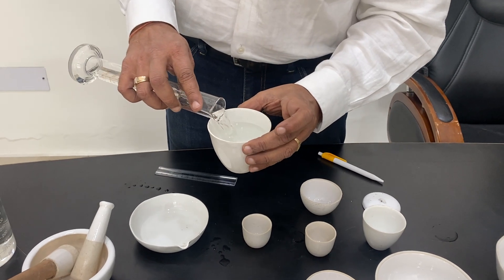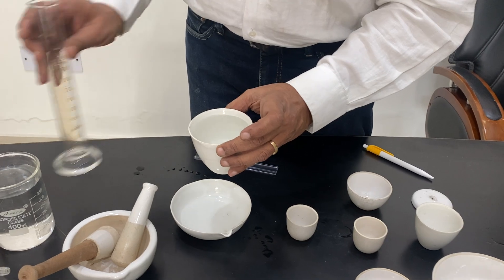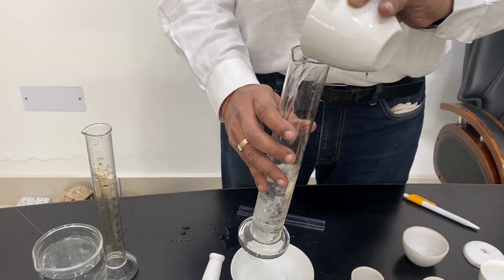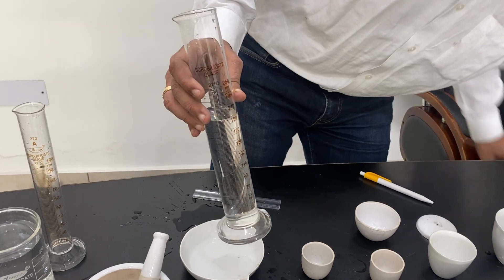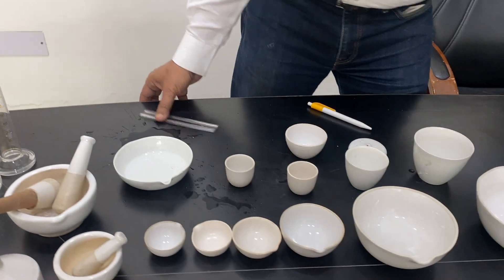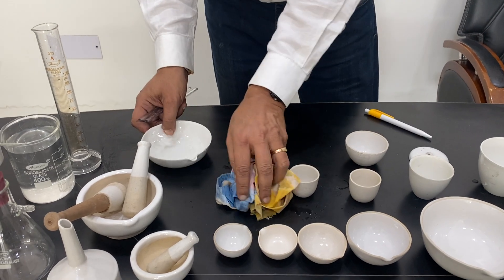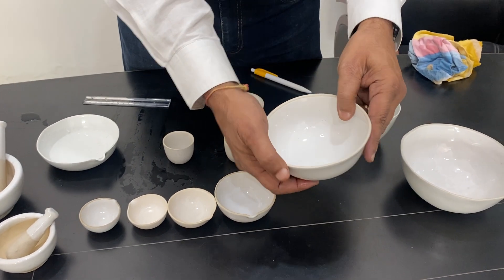The bigger one comes which is approximately 200 ml or more than 200 ml. They are generally measured in the form of ml — this is approximately 210 ml. Because there is no lip, the water or chemical may fall, so this is not for pouring. Only the china dish is used for pouring.